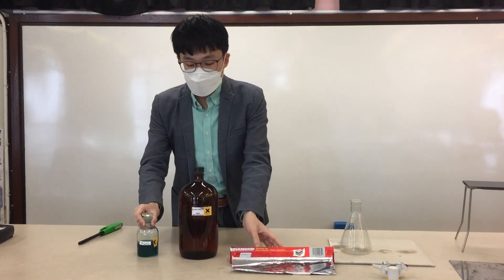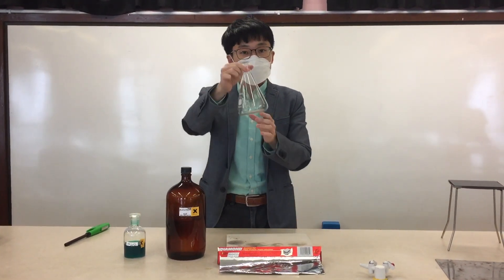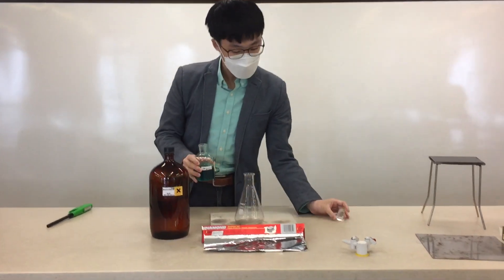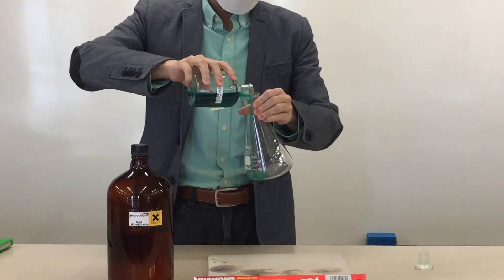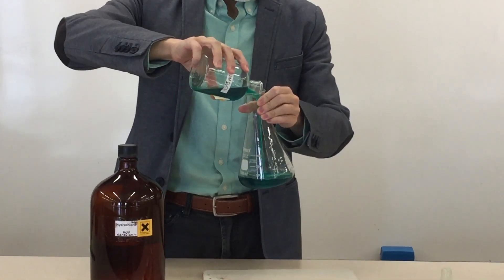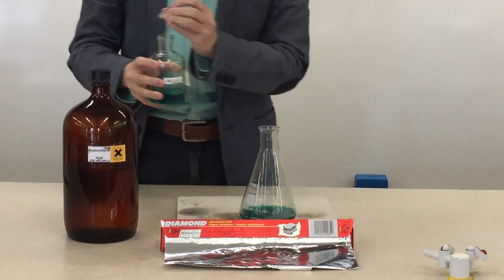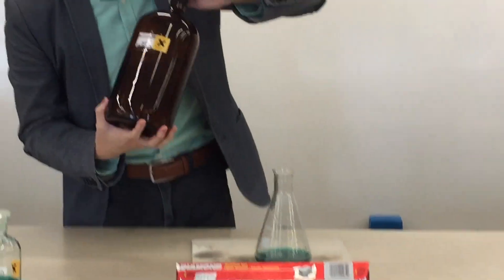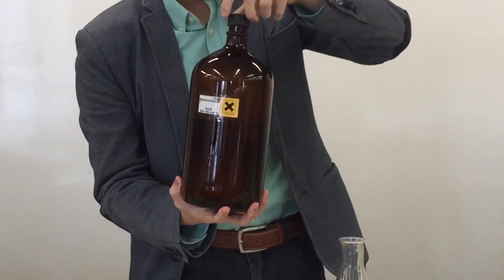Now we're going to add the copper(II) chloride solution into a conical flask here. We'll add a little bit, and then fill it up a little more by adding 2 molar hydrochloric acid into it.